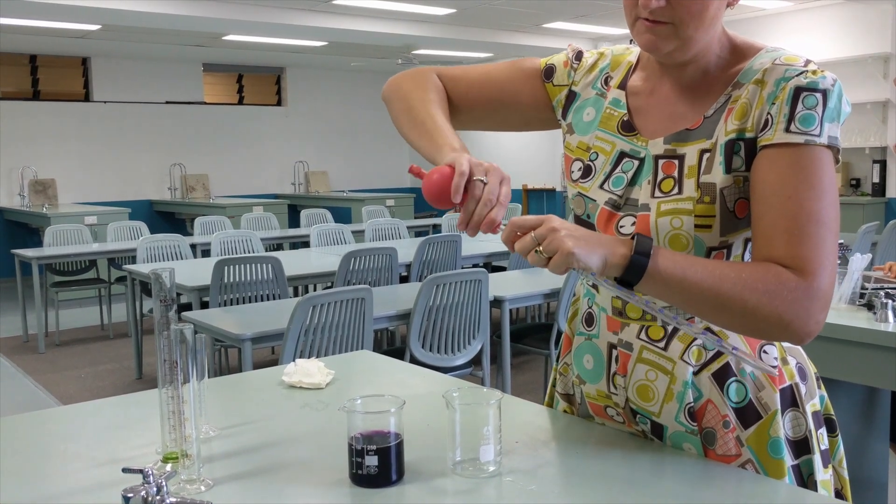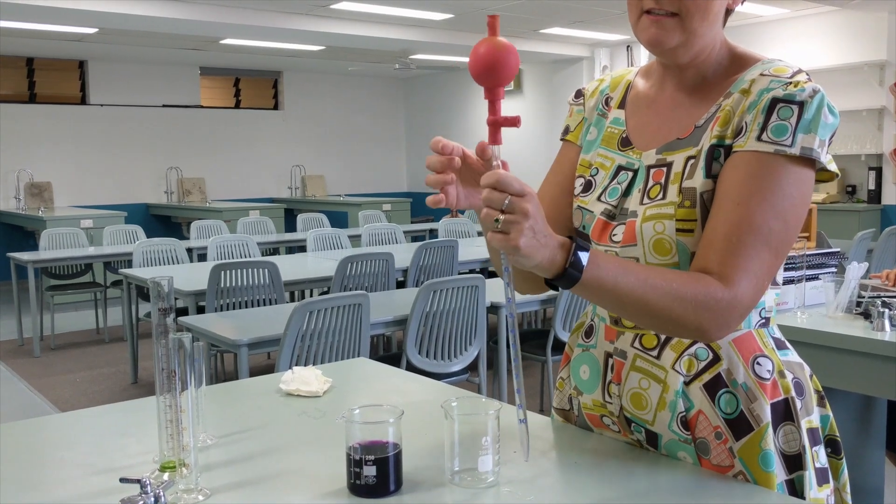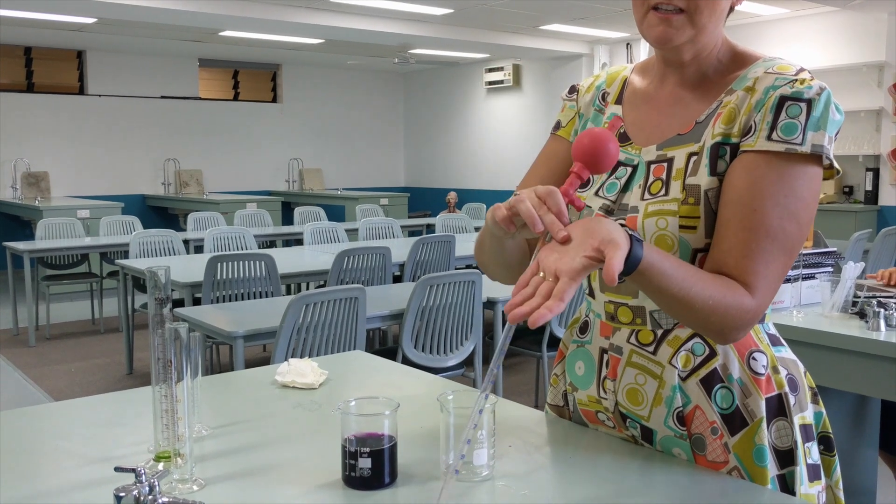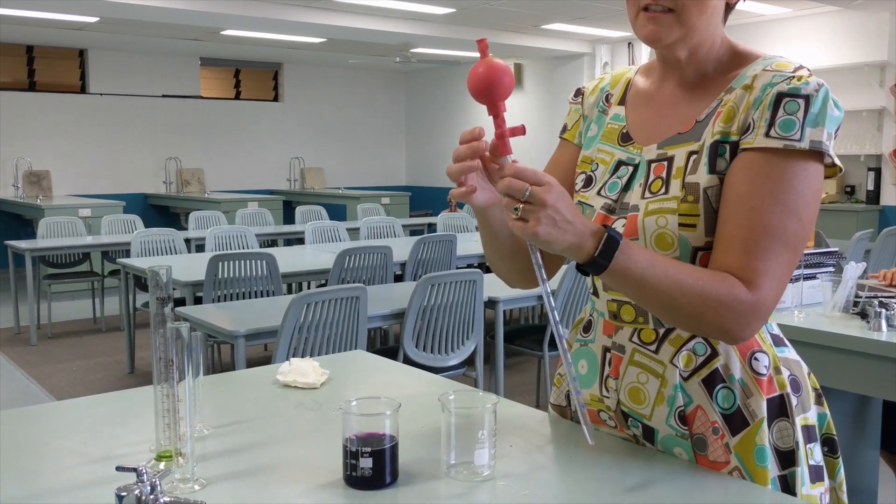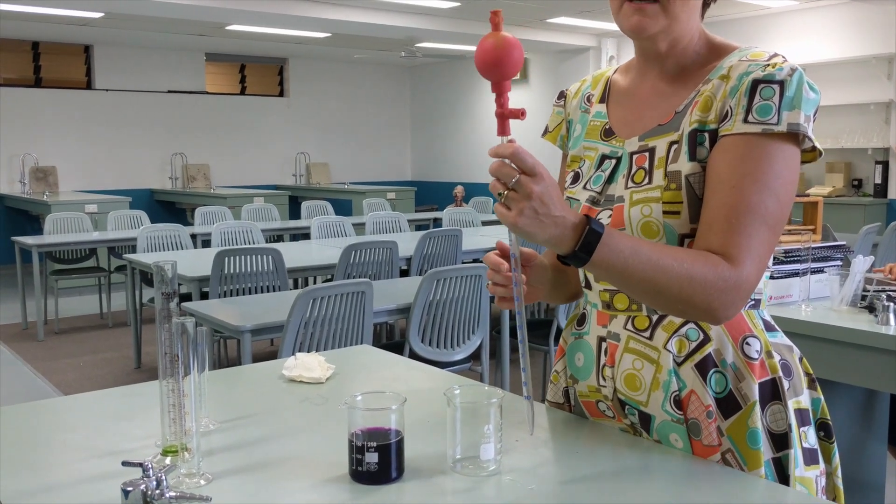Just be gentle. It's very easy if you use too much force to snap the pipette, and if that happens the broken edge can gouge into you, so be very careful and gentle. If you're worried at all or if you're in any doubt, ask your teacher for help.